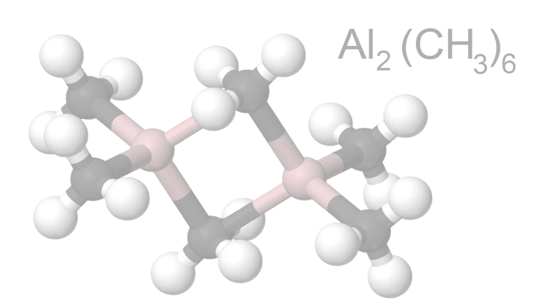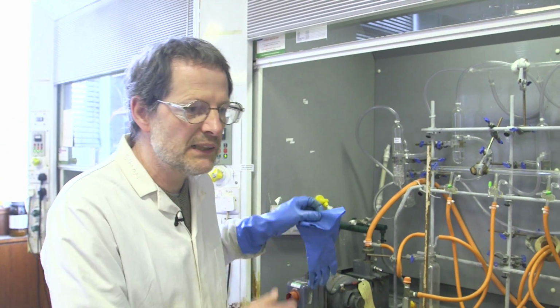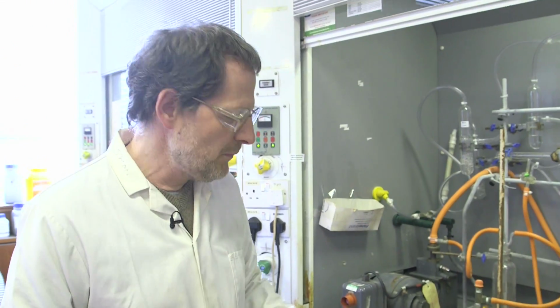It's quite hard to get accurate numbers, but it's at least 10,000 tons per year. And you'd think, hey, that's a useful compound. We should be able to do some chemistry with that, both in the lab and on industrial scale. But unfortunately, the compound has one or two problems associated with it. And we're going to show you that by attempting to weigh out some trimethylaluminium in air.